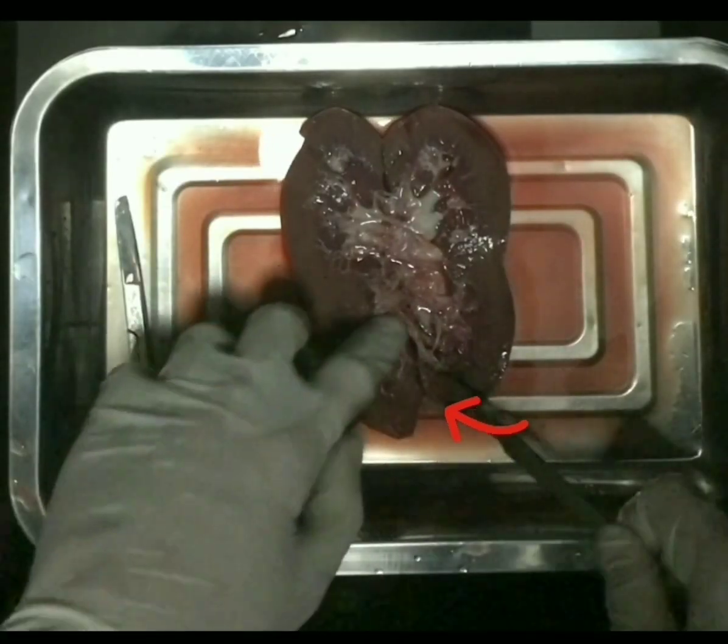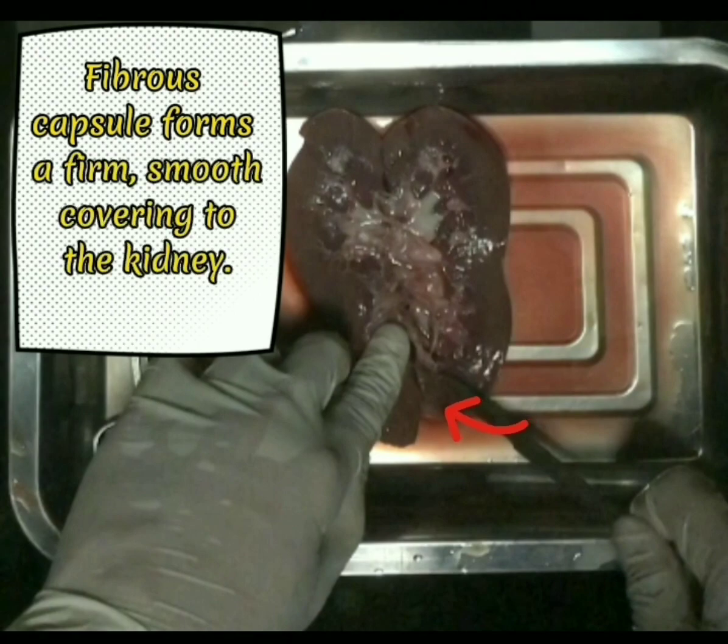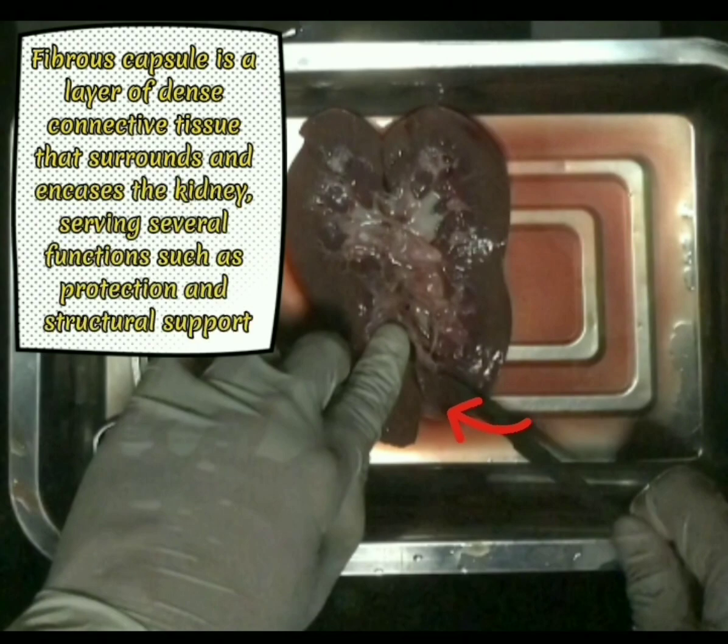This is now the fibrous capsule. Fibrous capsule forms a firm, smooth covering to the kidney. The fibrous capsule is a layer of dense connective tissue that surrounds and encases the kidney, serving several functions such as protection and structural support.